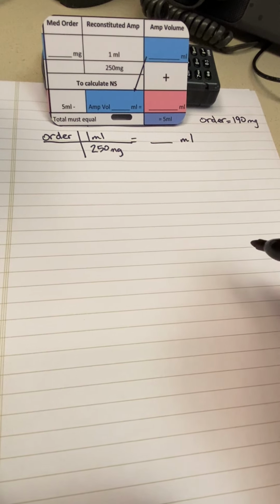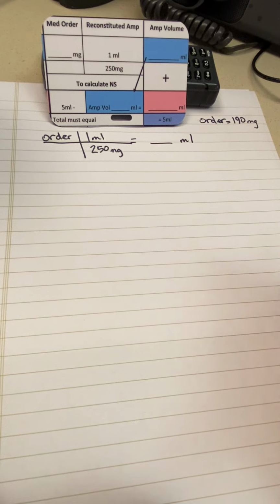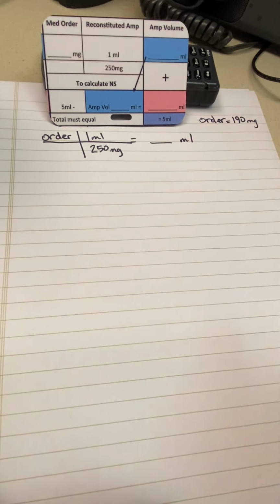Today we're going to be going through how to reconstitute and do the dosage calculation in order to mix ampicillin in the NICU. Of course, the first line is always going to be to have the pharmacist come mix it in NICU, but if they are unavailable, you will be mixing your own ampicillin to give so that we can give it within the 60-minute deadline.